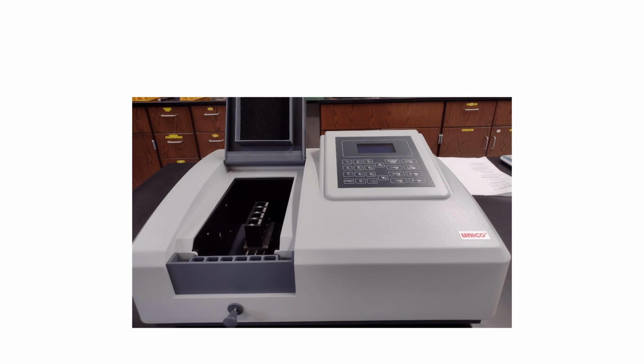So this is just showing right here what the spectrophotometer looks like. That's just showing a closer up view of the little dial. This is a nice piece of equipment. We can adjust the wavelength that we measure when we are measuring for monitoring growth of bacteria. We tend to measure that at 600 nanometers. We can change that wavelength so that we can measure protein, or we can measure DNA, or there's a huge wide variety of different experiments that can be done using the spectrophotometer, not only in biology but also in chemistry.